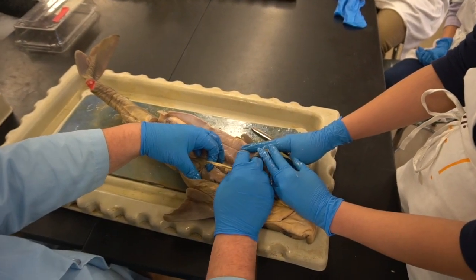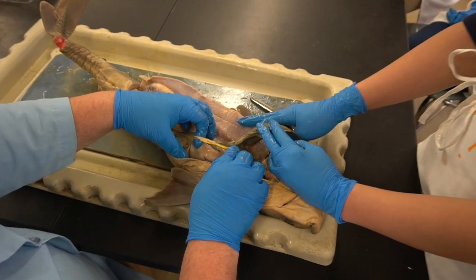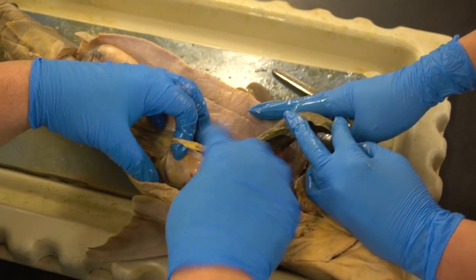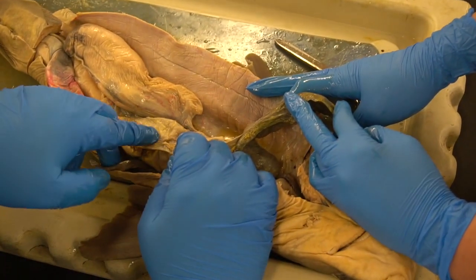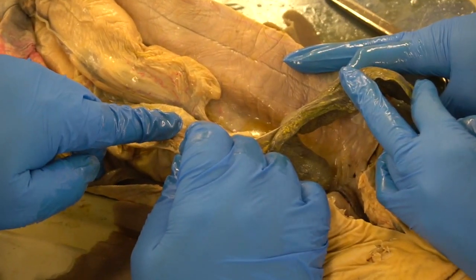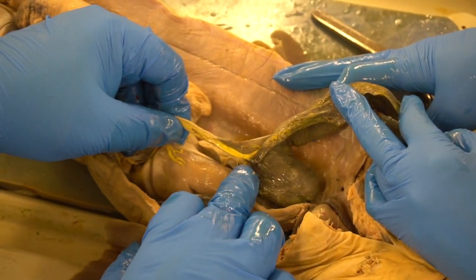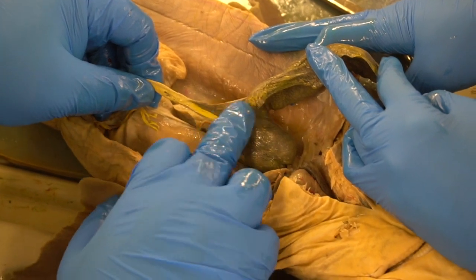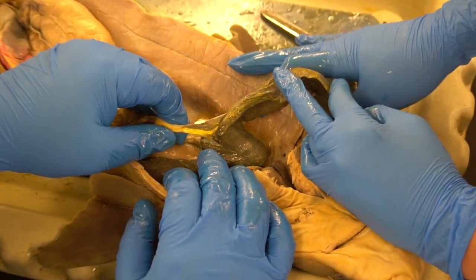So here, the common bile duct is the duct that is going to deliver from all the lobes of the liver combined down to the area of the intestines, which is called the duodenum, which we'll get to in a moment. Okay, so hence the common bile duct. It does split. You can see a little evidence of that here. It does split into sides and become like a left and a right, going towards the lobes of the liver.